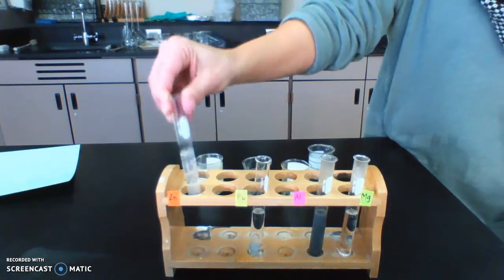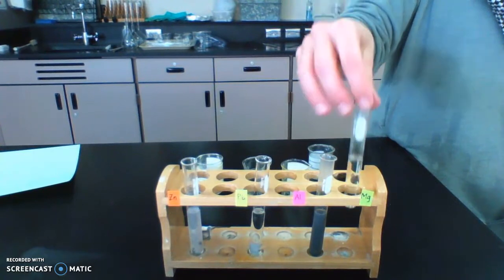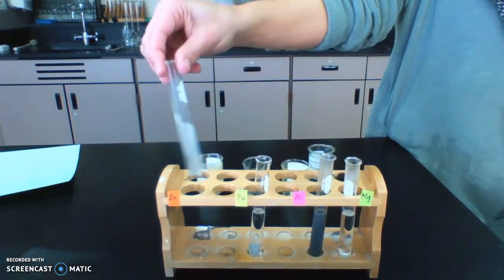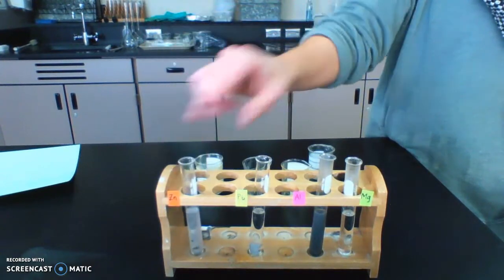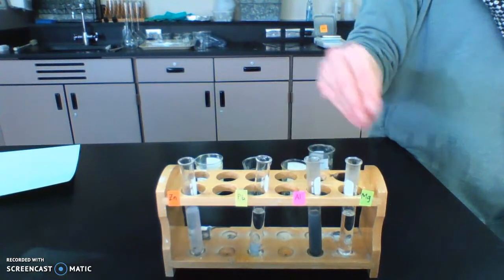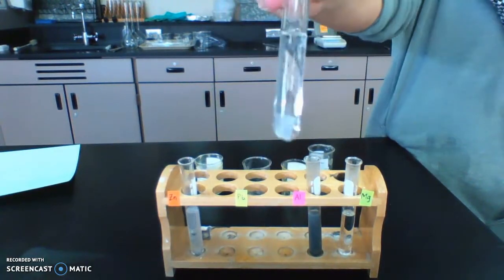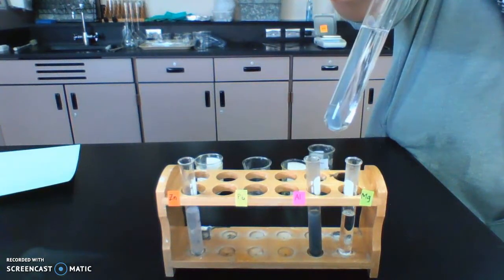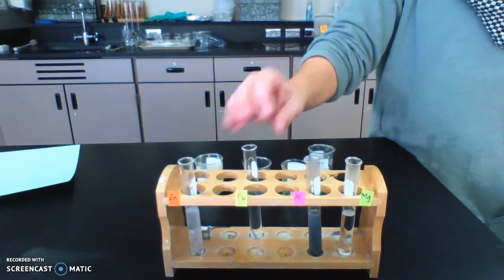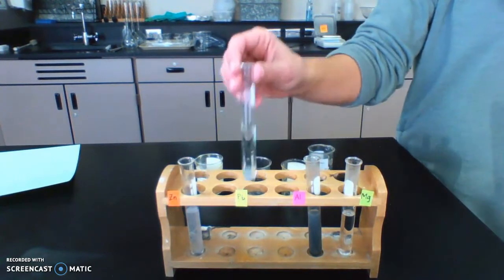So it seems to me the magnesium reacted the quickest. The whole test tube is hot. I can barely hold it, right? Then the zinc got going pretty quickly after that, and then aluminum took a little bit longer, also warm. So those three were all warm and gave off gas bubbles as they reacted. And the lead, nothing. So non-reactive. So I can actually wash this lead off and use it again. So that is part 3 with these 4 metals in acid.